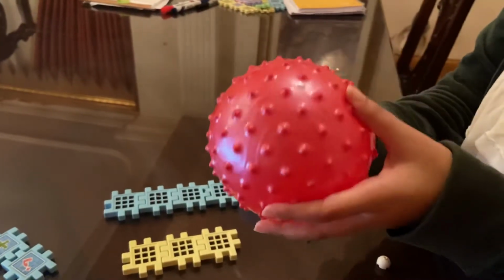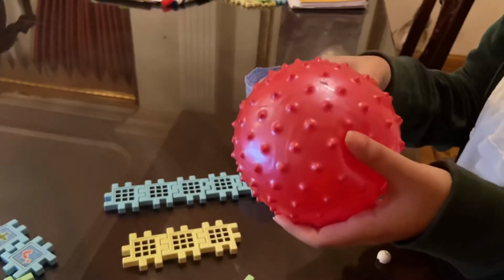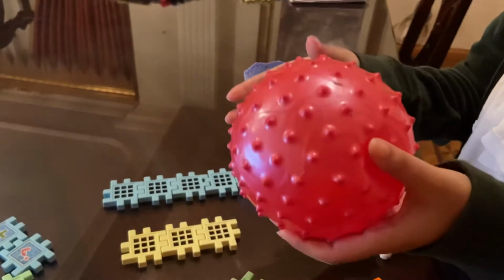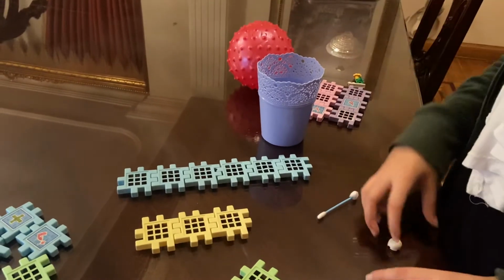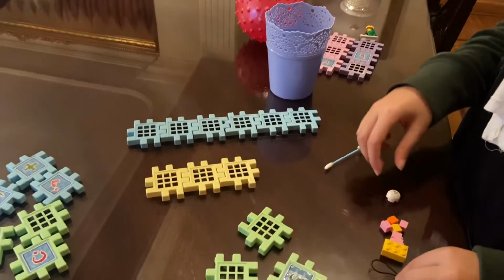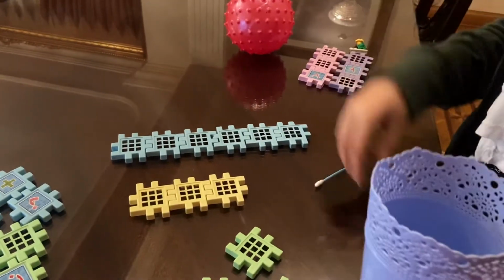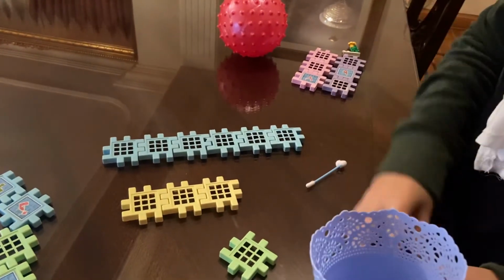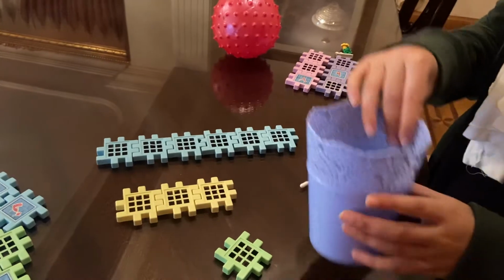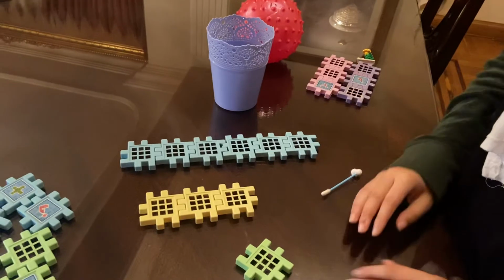So this represents the COVID-19 virus, and it is an RNA virus, so we will use reverse transcriptase PCR instead of the normal PCR process. So the RNA is extracted from the sample, and then it is added to the solution with the reverse transcriptase enzyme, the nucleotide, and the primer. So the sample is then heated and quickly cooled, and then the primer binds to the RNA.